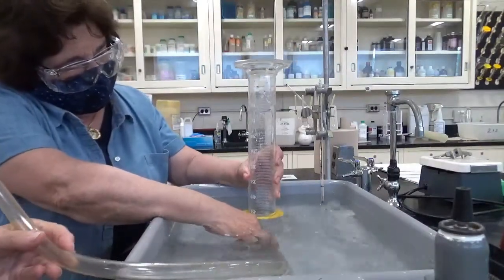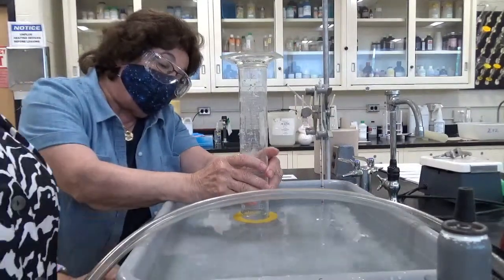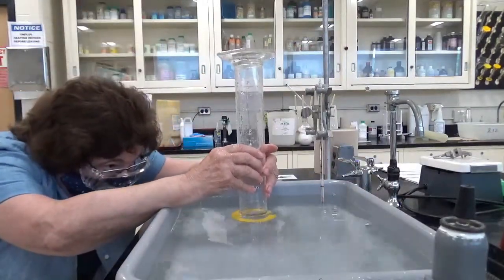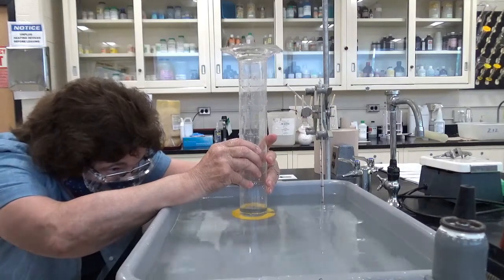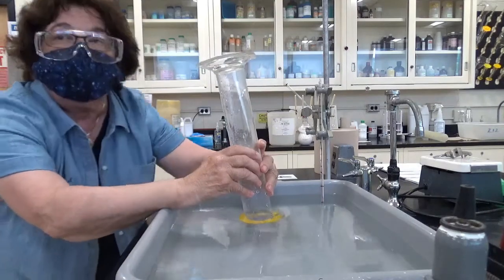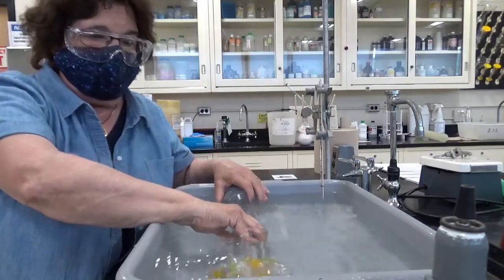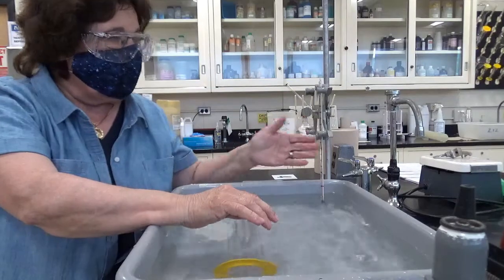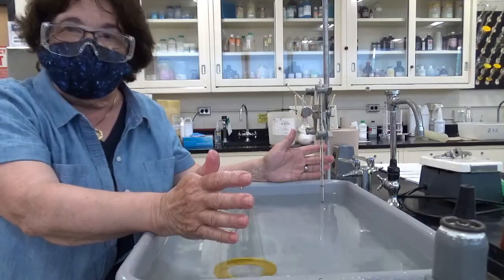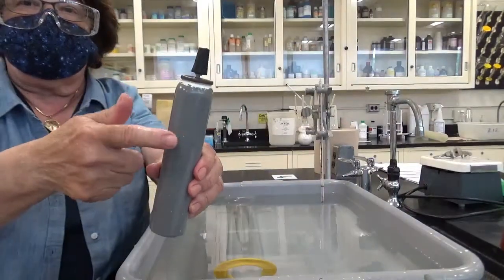All right. If I equalize the two, I have done that now. Let's see what I have. I'd say 480 milliliters of gas. The other conditions are the same: the same temperature, the same pressures. Now we're going to mass the cylinder again for the after and see how much gas actually came out.